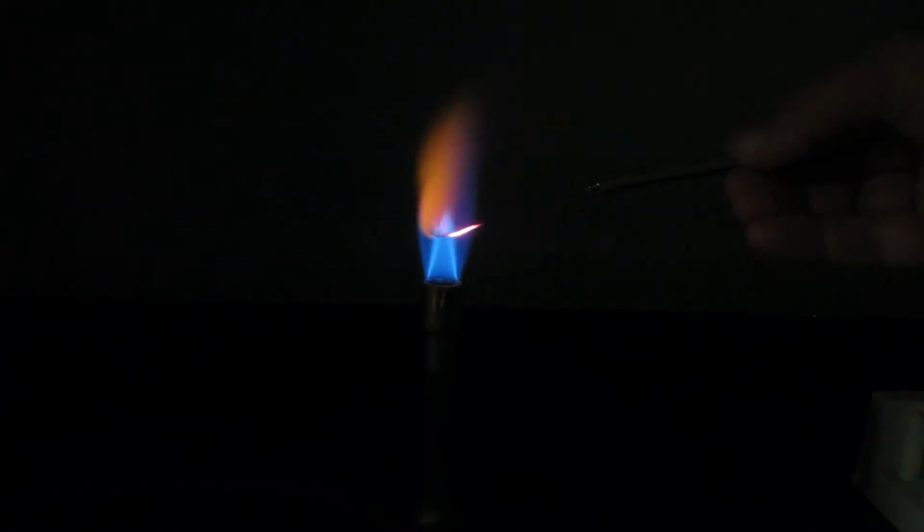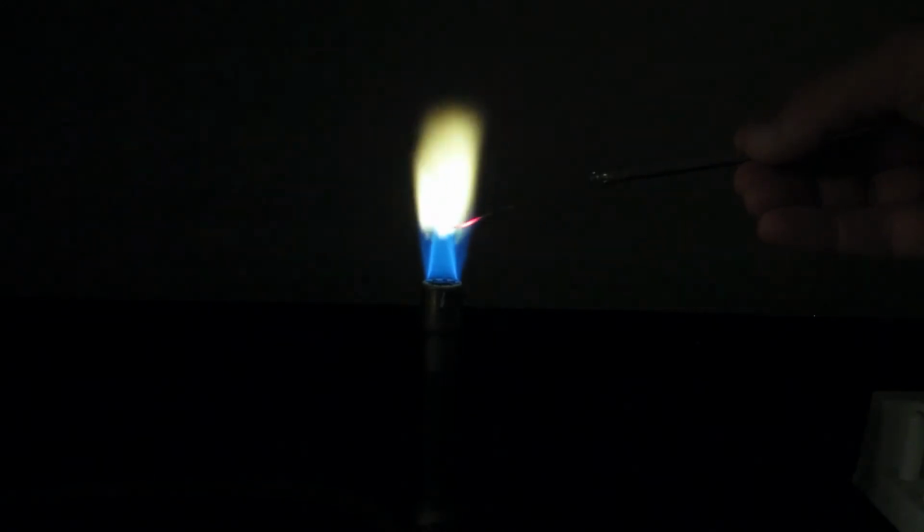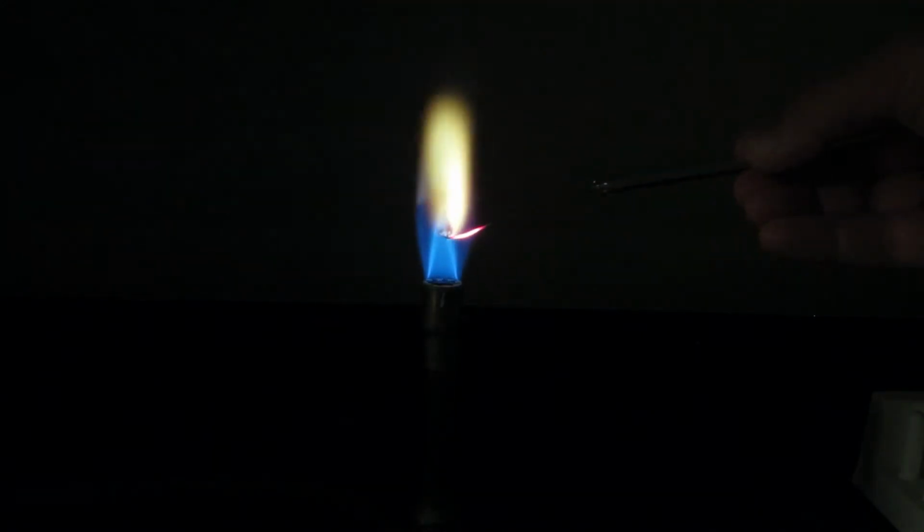So what you're going to do is you record the color for the remaining salt solutions, and then you'll see a flame test for one unknown. And then based on the color of that unknown, then you should be able to determine which compound that unknown is associated with. This one here is barium chloride. The sample coming up here is calcium chloride.